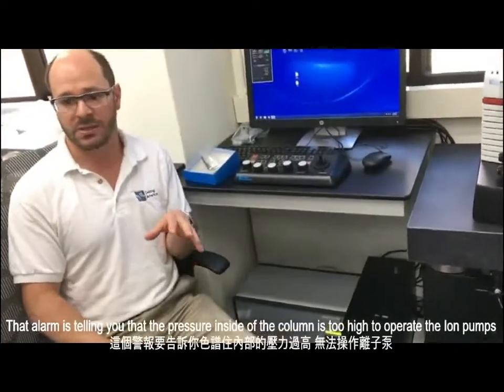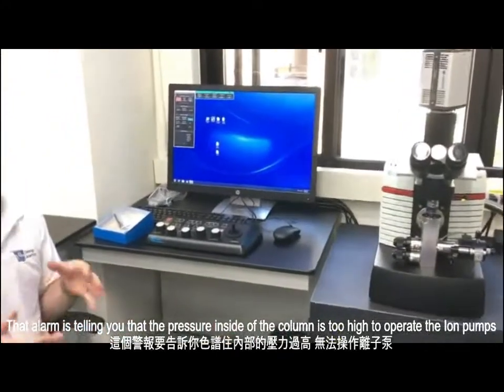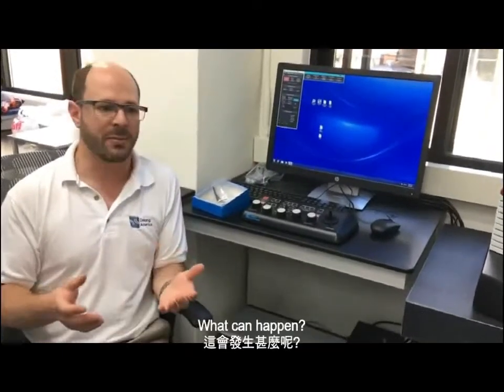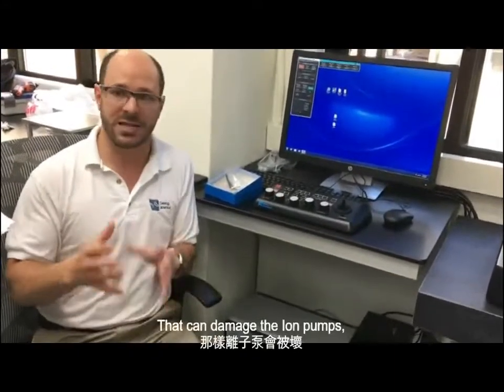That alarm is telling you that the pressure inside the column is too high to operate the ion pumps. The ion pumps don't turn off by themselves. The ion pumps are continuing to operate even though the pressure is too high. What can happen? If the pressure is too high and the ion pumps are running for too long a time, that can damage the ion pumps.